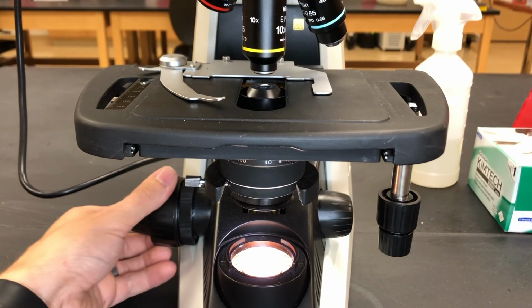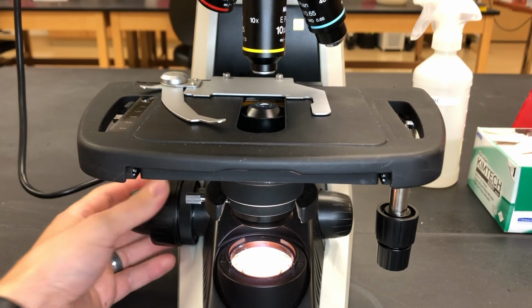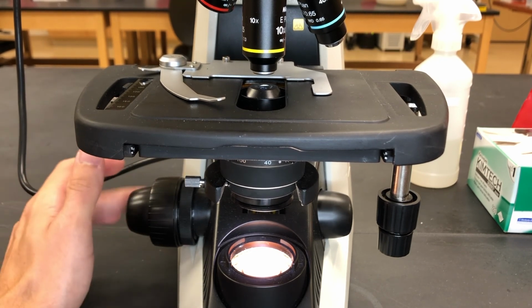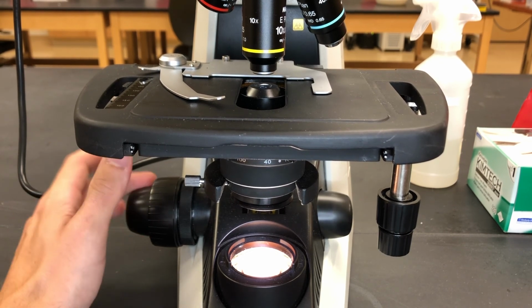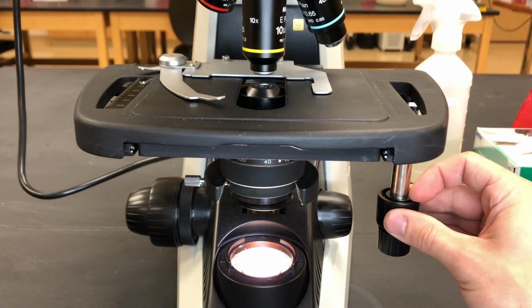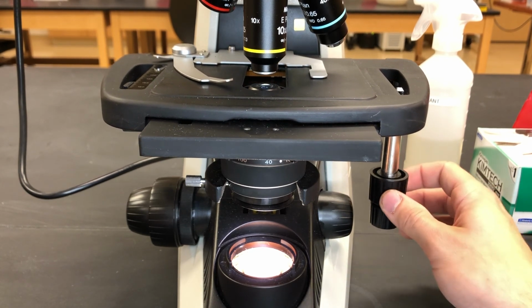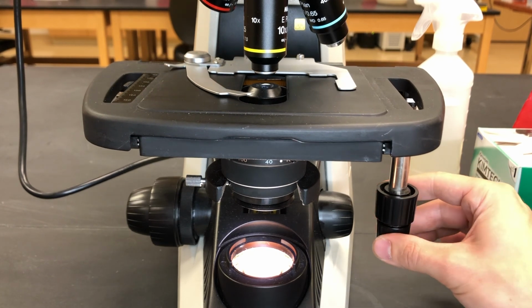Let's look at the knobs. On the left hand side here we have the coarse adjustment knob. It moves the stage up and down pretty drastically. Next to that we have the fine adjustment. If you look really closely, it is moving the stage up and down as well. Both of those knobs are used for focusing your specimen. If you look on the right hand side, you have your stage knob. That will move your stage horizontally. Go side to side, front to back. It's going to help you explore your specimen. Note that it doesn't help you to adjust the focus though. That's just going to be on your coarse and fine adjustments.